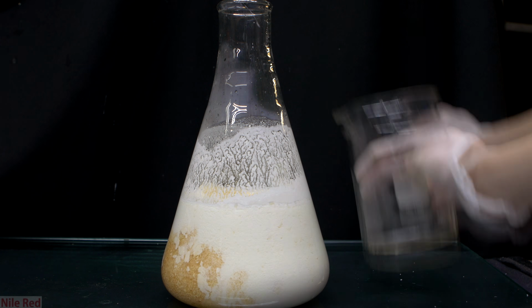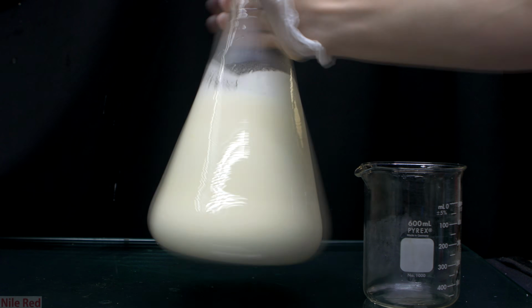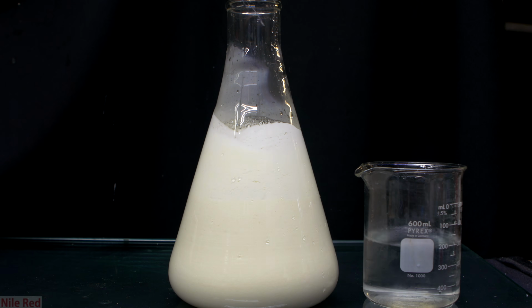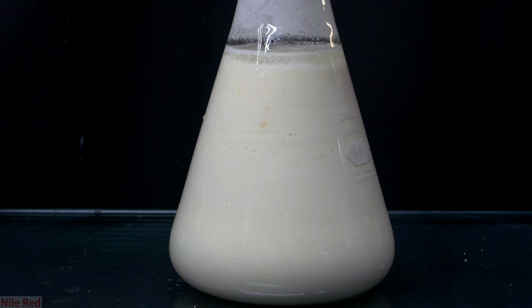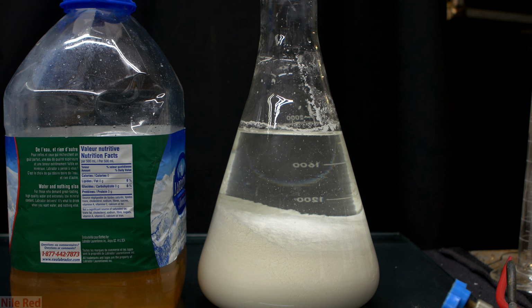You'll see here that I added a bit too much too quickly at the end, and a little bit of yellow appears. Luckily, I was able to get rid of this by just swirling it around a little bit, but you really don't want this tainting your reaction. After everything was added, I just washed the beaker a few times. After all the washings have been done, just let the Erlenmeyer flask sit, and the mercury thiocyanate should settle to the bottom.